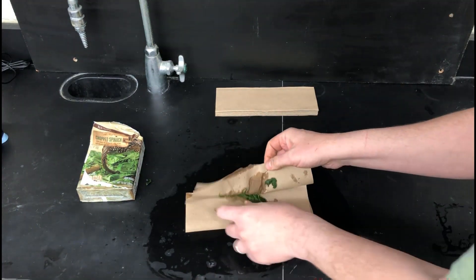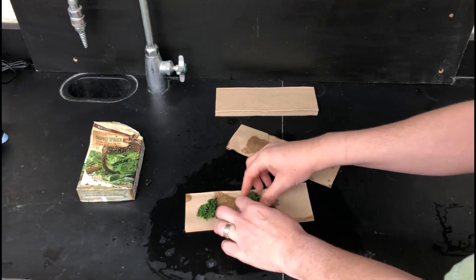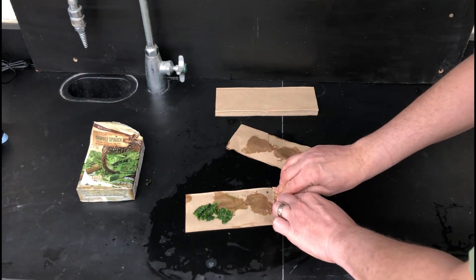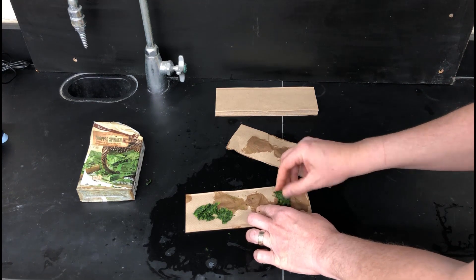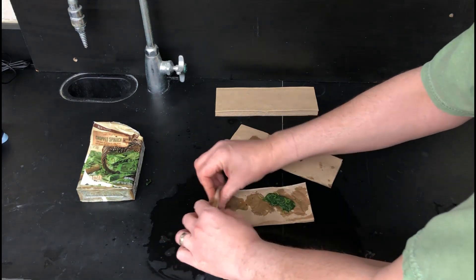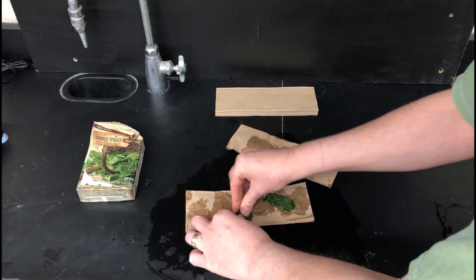The step of getting rid of the water is really important to get the best results in the extraction of pigments later on. So it pays to spend some time to try to get as much out as you can. It'll make the next step easier as well.